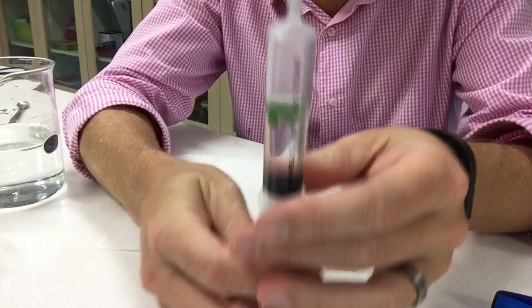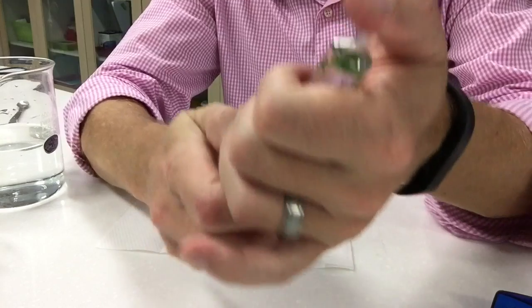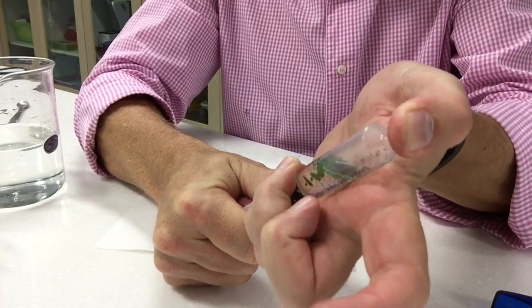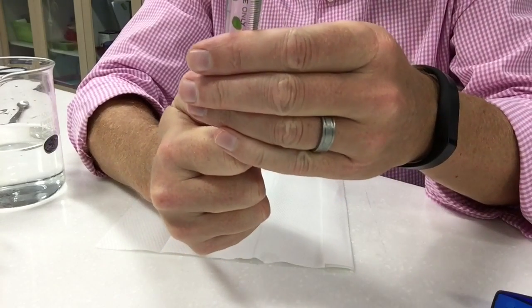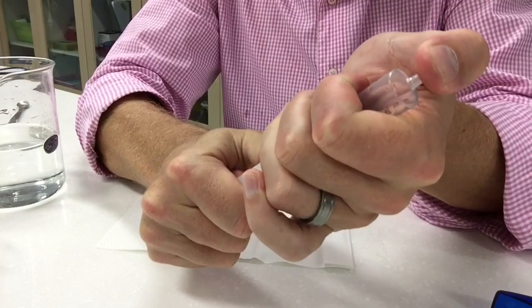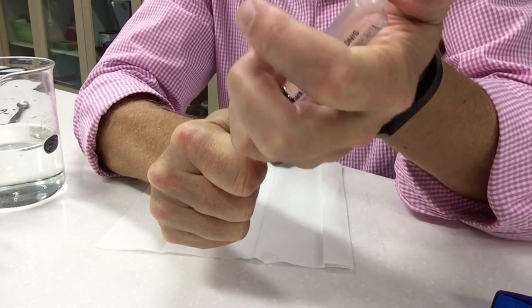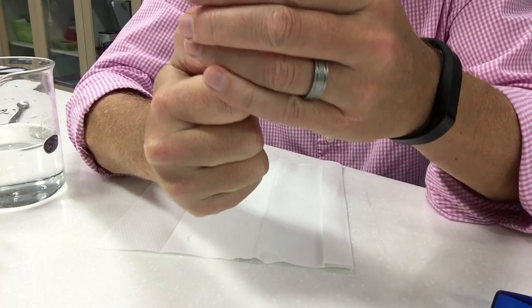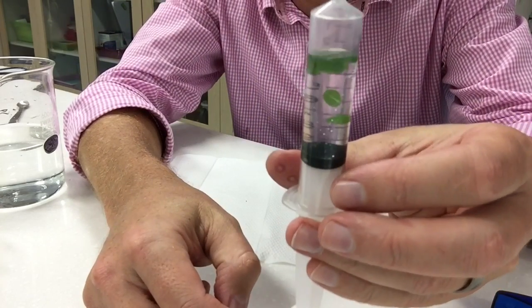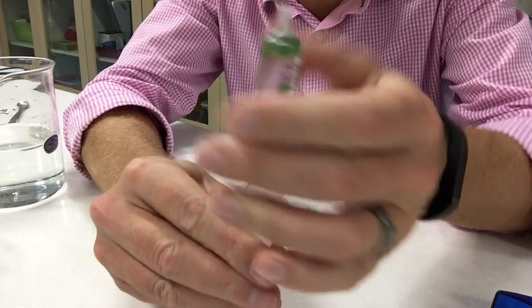Now that's not going to do much the first time so we're going to do it again. Evacuate, shake it up a little bit, let go, put it back up and you're just going to keep doing this until you see that those things are going to start to sink. Now they're starting to, there's a couple of them starting to drift down so we're on the right track and you just keep doing it.